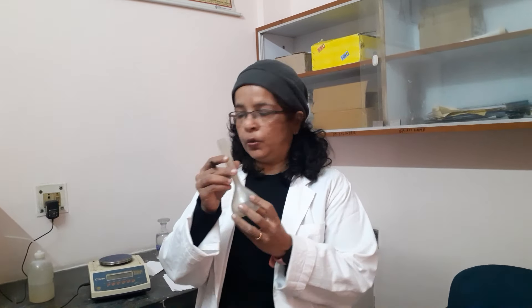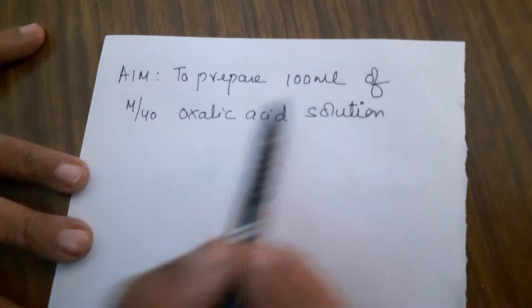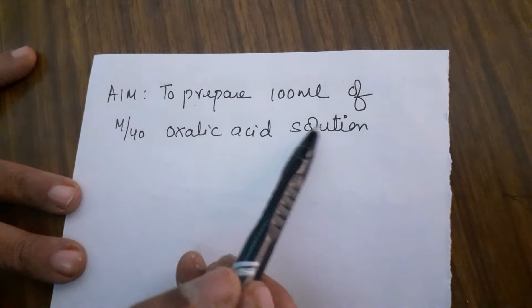Today's video is on preparing the standard solution of oxalic acid, which you require for your redox titration. For oxalic acid you are normally asked to prepare M/40 solution. How much to make — your teacher normally tells you, or it depends on the measuring flask in your lab. If the measuring flask is 100 ml, your teacher will ask you to make 100 ml; if it is 250 ml, then 250. I am using a 100 ml flask, so I will be preparing 100 ml only. So, the aim of today is to prepare 100 ml of M/40 oxalic acid solution.